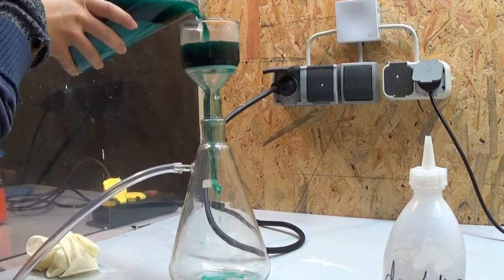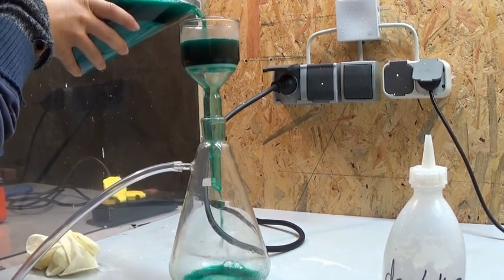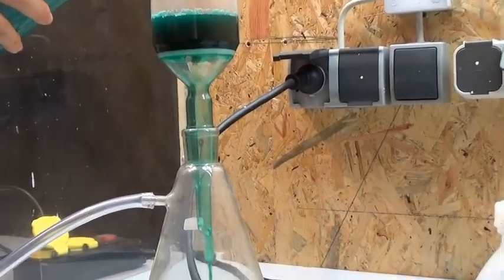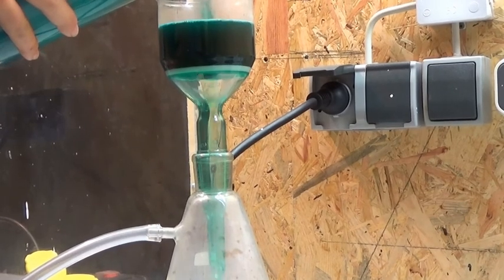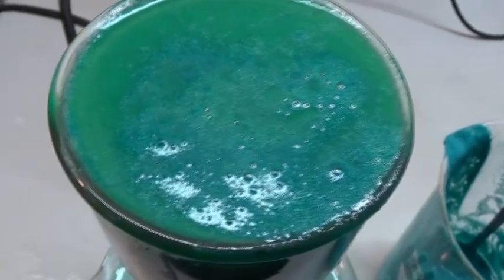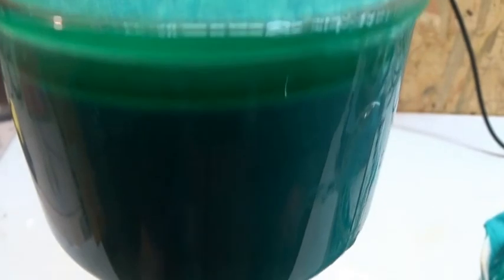Now what's left to do is filtering off the calcium sulfate and getting your solution of copper acetate. I did this with vacuum filtration but you can also use gravity filtration. You just have to wait a little bit longer for the gravity to do its thing.